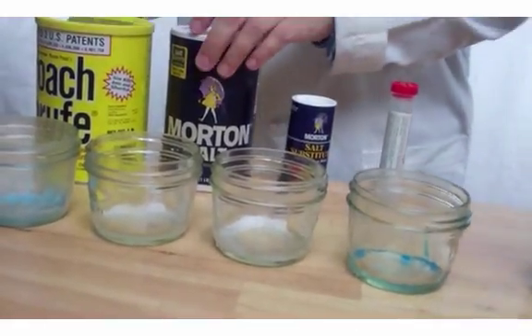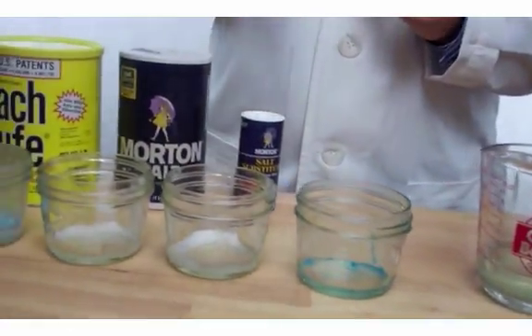Table salt, sodium chloride, salt substitute, which is potassium chloride, and some copper sulfate.